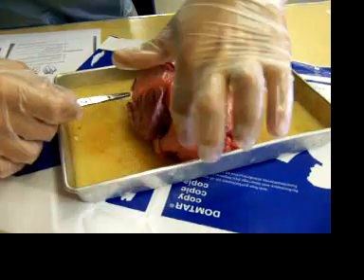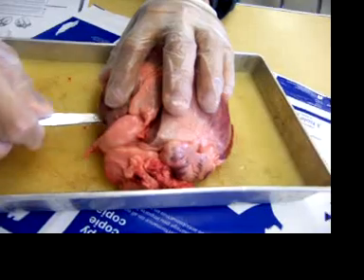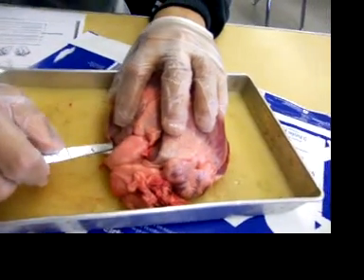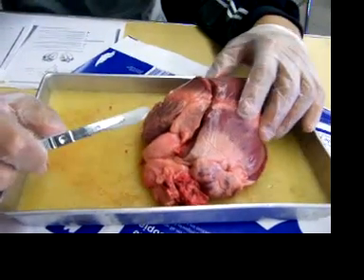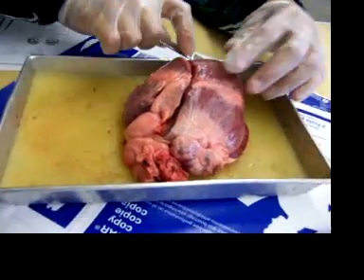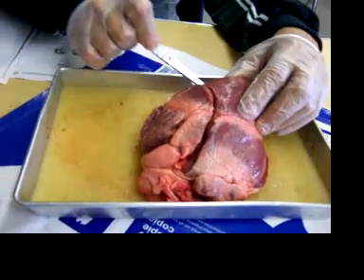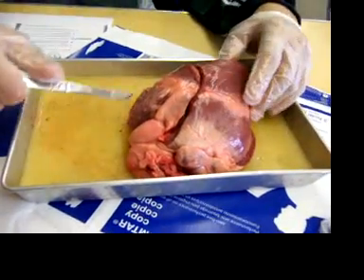Up through this, through the whole thing. Yeah, that's gonna cut. Should I cut the aorta in half? Yeah. Do what you want. I'm not advising you to do anything. Do it, man — all the way up, it has to be in half. Pretend you're running it through a bandsaw and just cut it. I massacred the inside of this heart. Yeah.